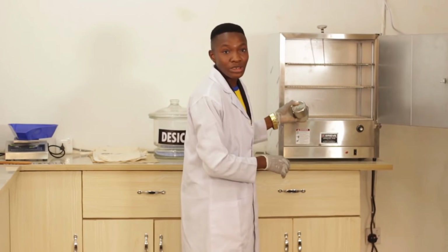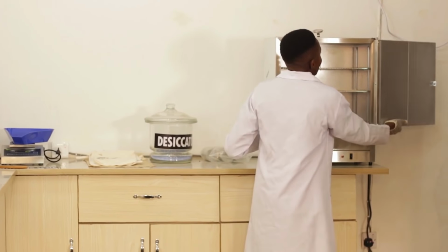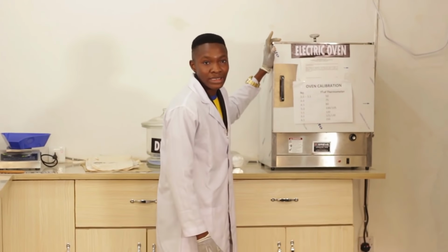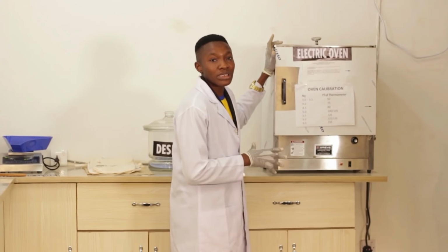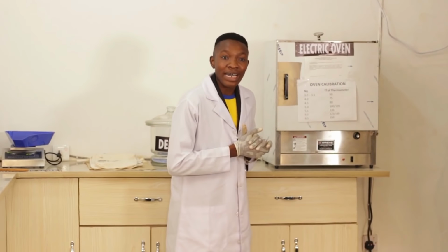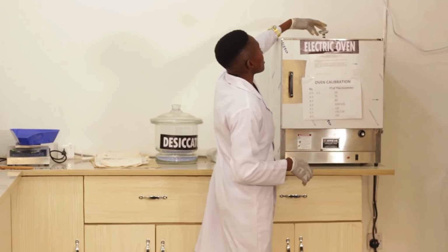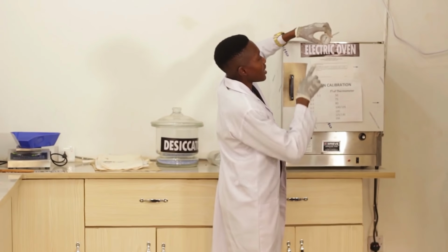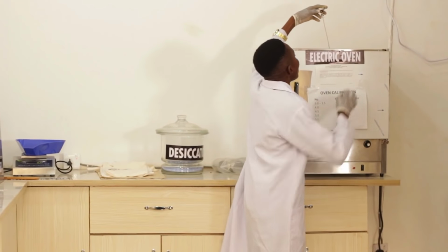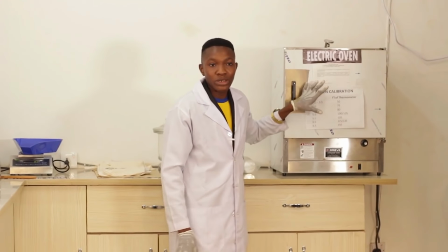That's after calibration. Then put it into the oven and allow it to dry for about 3-4 hours to maintain a constant weight. Remember, before we started, we knew the weight of our can and we know the weight of the seeds that are inside. Your calibration is done with the aid of the thermometer attached to the oven. That helps you to know when the oven has gotten to the temperature you want.